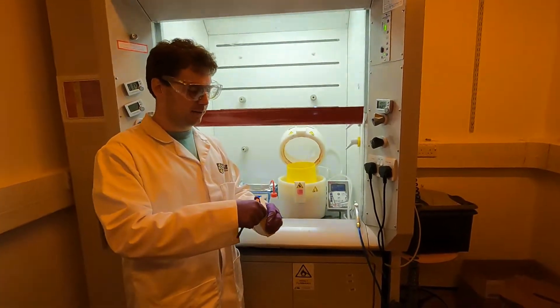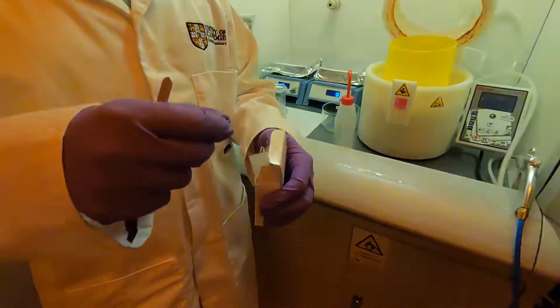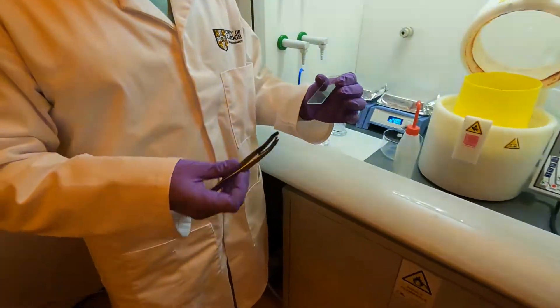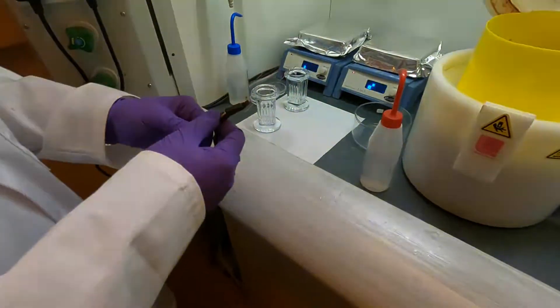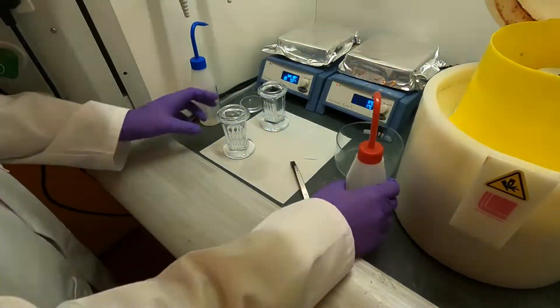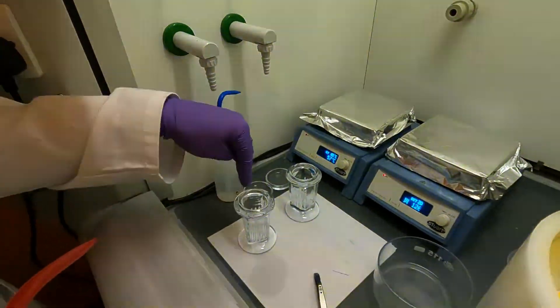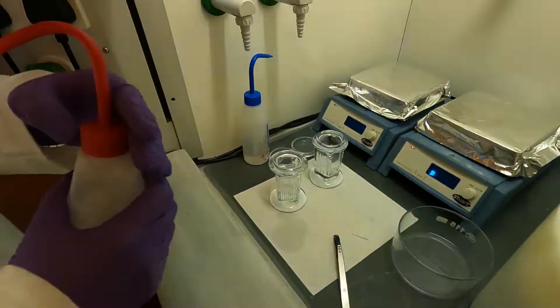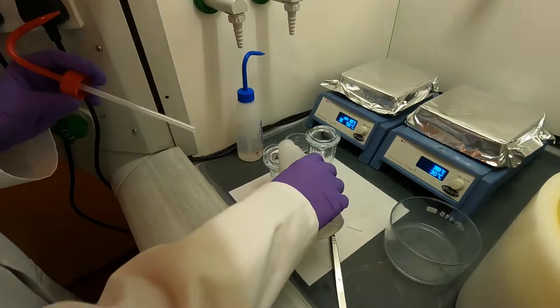We'll take one out - for now we can use just fingers in this first step. We take out one glass slide and then hold it with a pair of tweezers and give it a quick rinse with acetone. Before we do that, I'm going to fill up this glass staining jar, which is useful to slot in the glass slide and is particularly useful if we are preparing more than one sample at once. So I'm going to fill this staining jar with acetone.